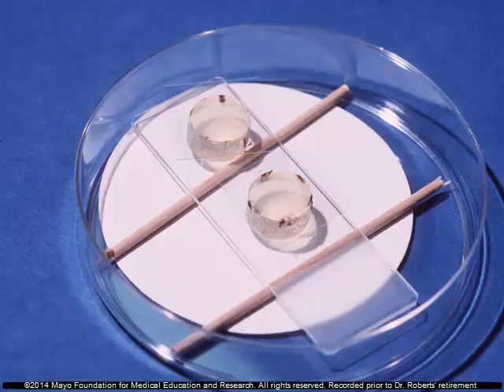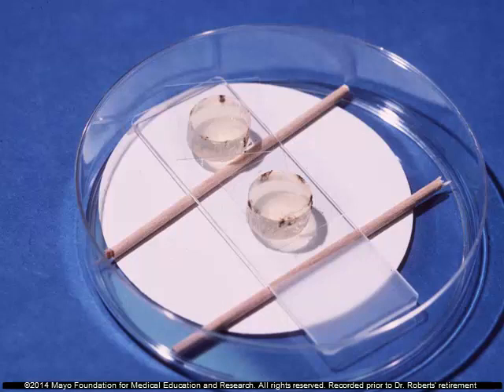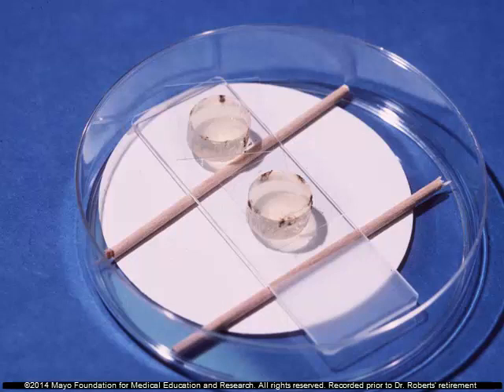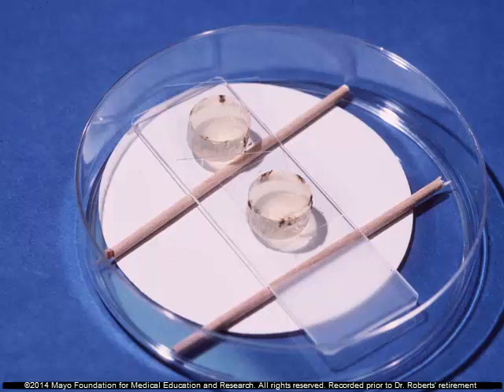Here's the inexpensive way to do it — it works well. You take a piece of filter paper, put it in a sterile petri dish, break a sterile applicator stick into pieces, and then put the slide on there with a couple of agar plugs and inoculate it. Put a cover slip on top and let it grow. Add some water in the bottom so there's enough humidity, and the filter paper will absorb the water.